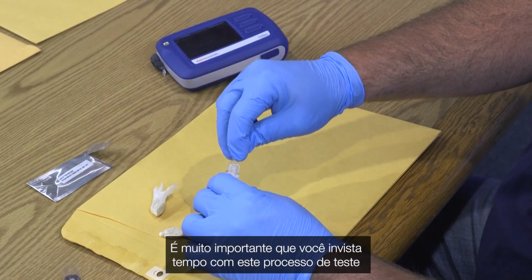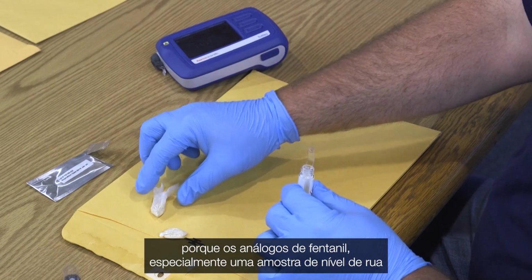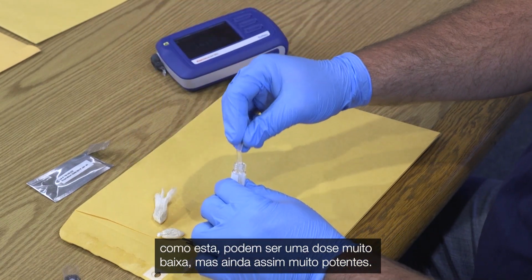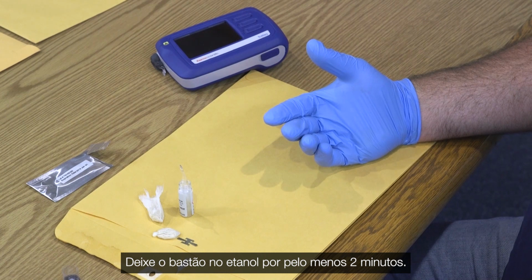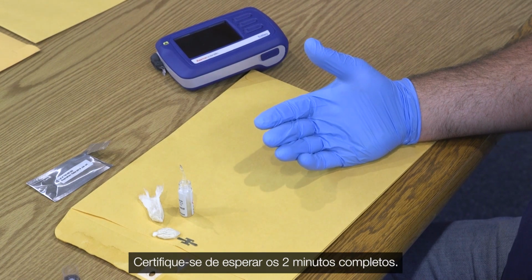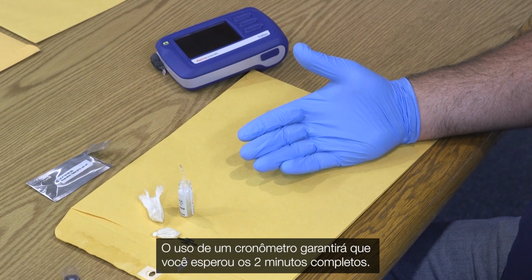It is very important that you take your time with this testing process because fentanyl analogs, especially a street-level sample like this, can be very low dose, yet still very potent. It may take a while for drug molecules to adhere to the metal substrate. Leave the stick in the ethanol for at least 2 minutes. Do not rush. Ensure you wait the full 2 minutes. Using a stopwatch will assure that you waited the full 2 minutes.